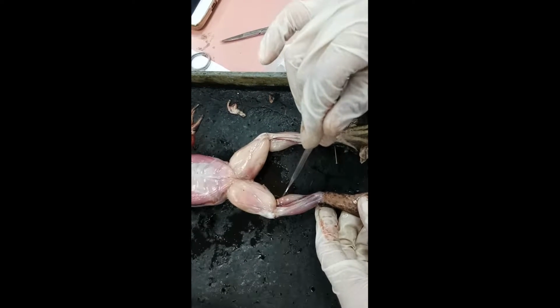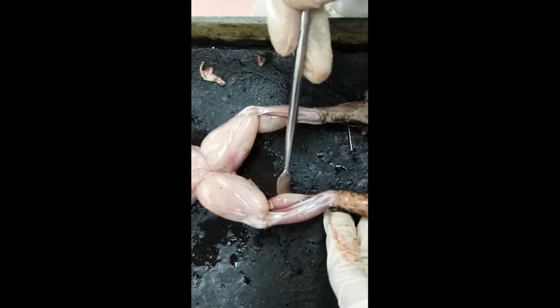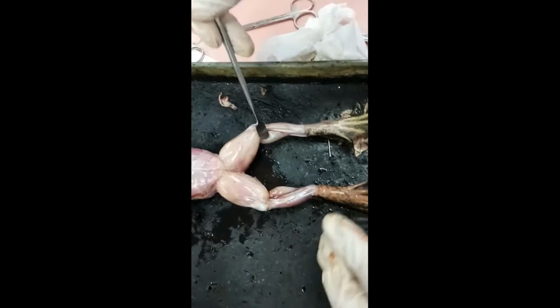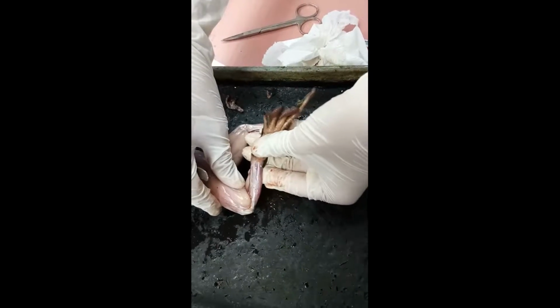This too is gastrocnemius, the larger bulging muscle visible on the surface along the median border of the shank. It extends the foot and flexes the shank. Okay.